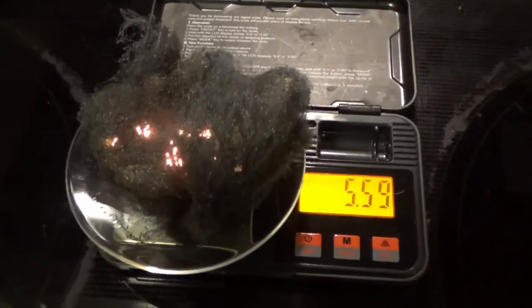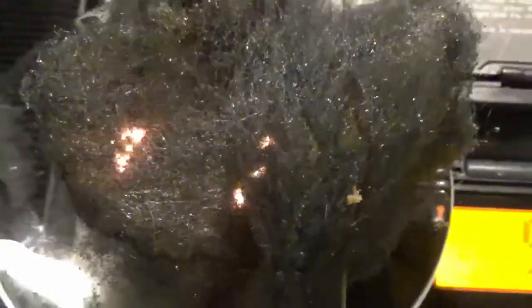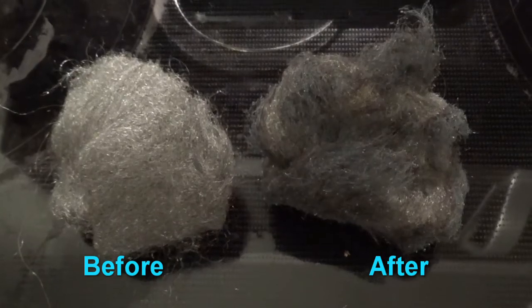For a quick reference, I'm also just going to include an unburnt one so you can compare the color. Let's go. This is my favorite.